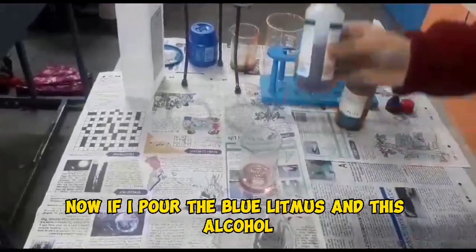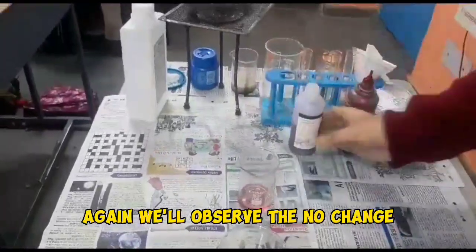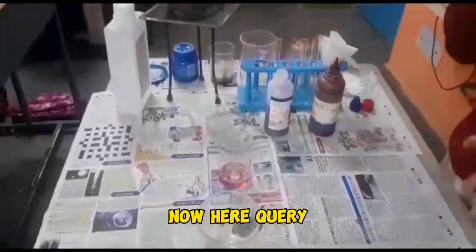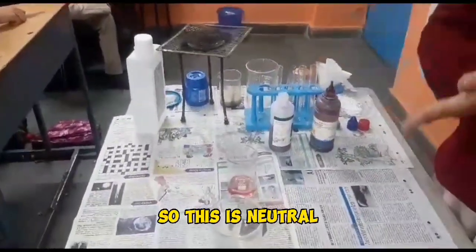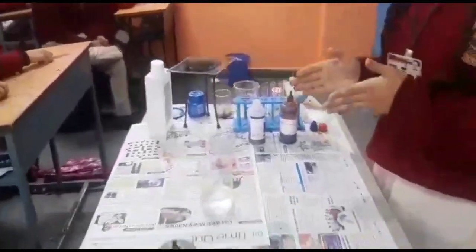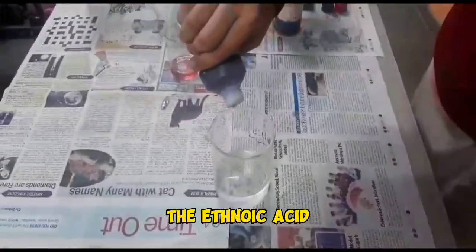Now if I dip the blue litmus in this alcohol, again we observe no change. So this clearly depicts that ethyl alcohol is neutral in nature. Now the question arises, why is it neutral? It is neutral because of the absence of hydrogen ions, and it doesn't easily dissociate into ions, therefore it is neutral.